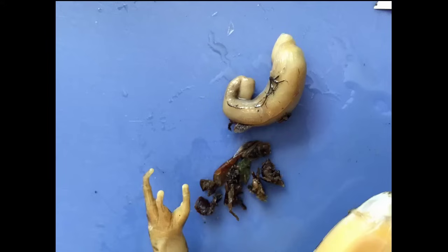I removed the stomach by cutting it at the top and the bottom and emptying out the contents — you can see there are all kinds of insects and flies in the frog's stomach that are whole, because the frog does not chew its food. So all of the digestion happens after the stomach, in the small intestine and the large intestine. And that's where we will leave off for today — I hope you enjoyed it.